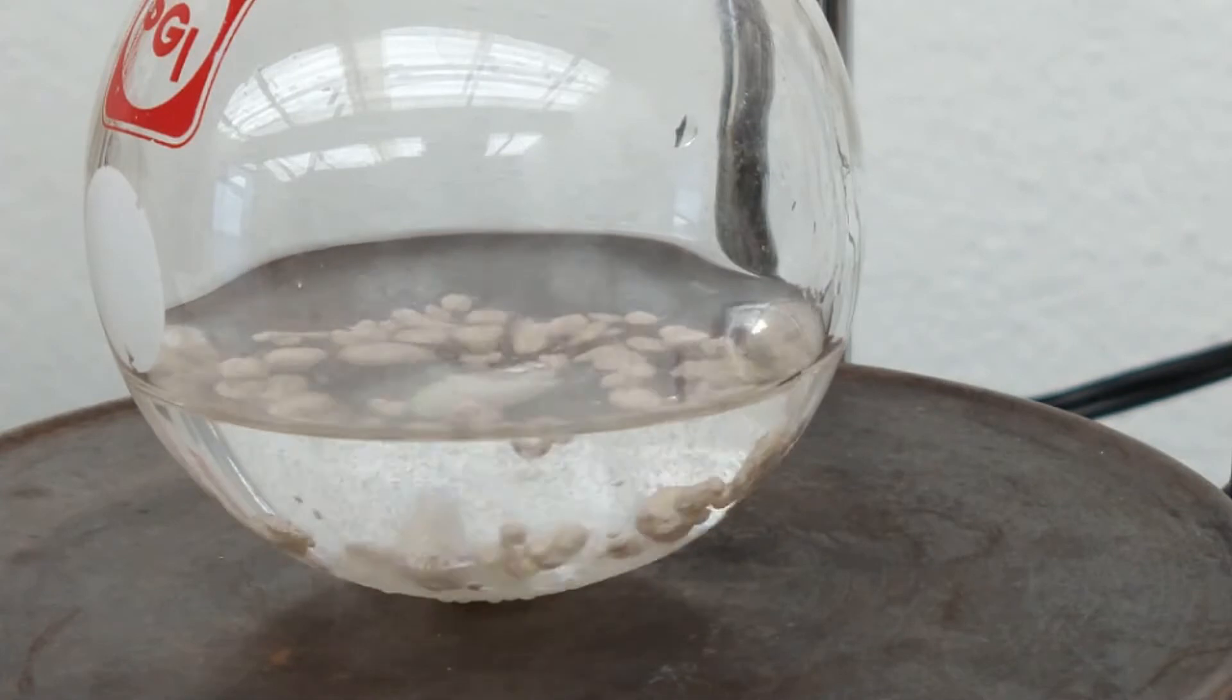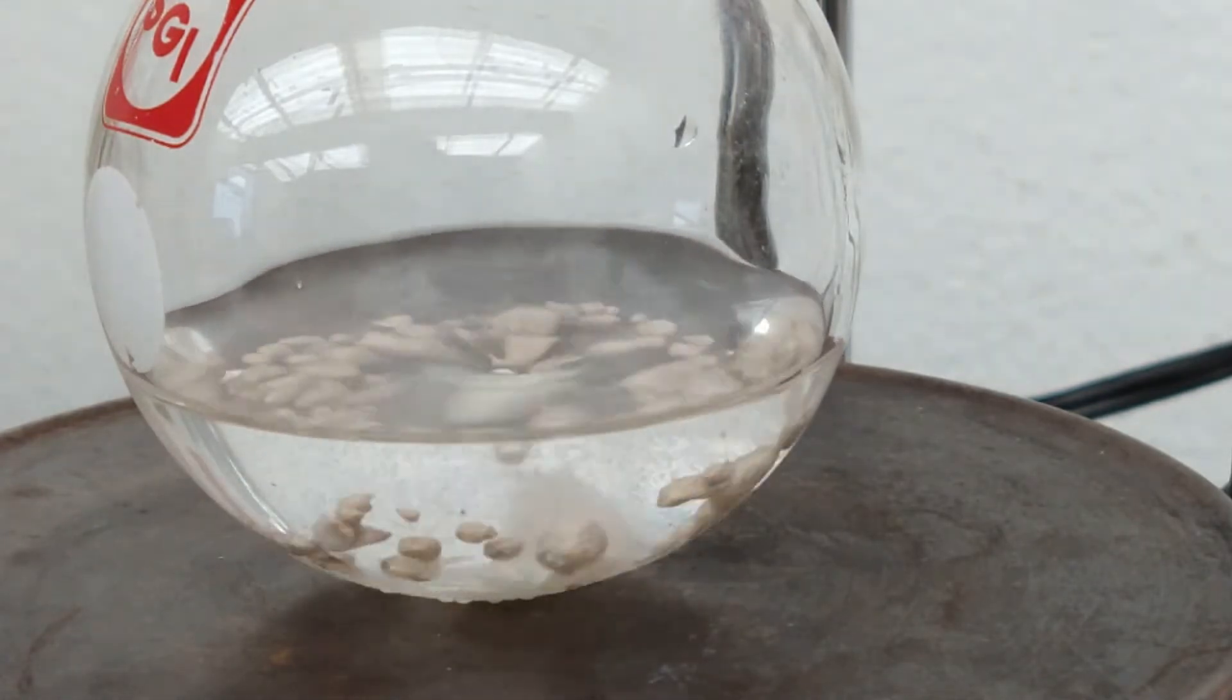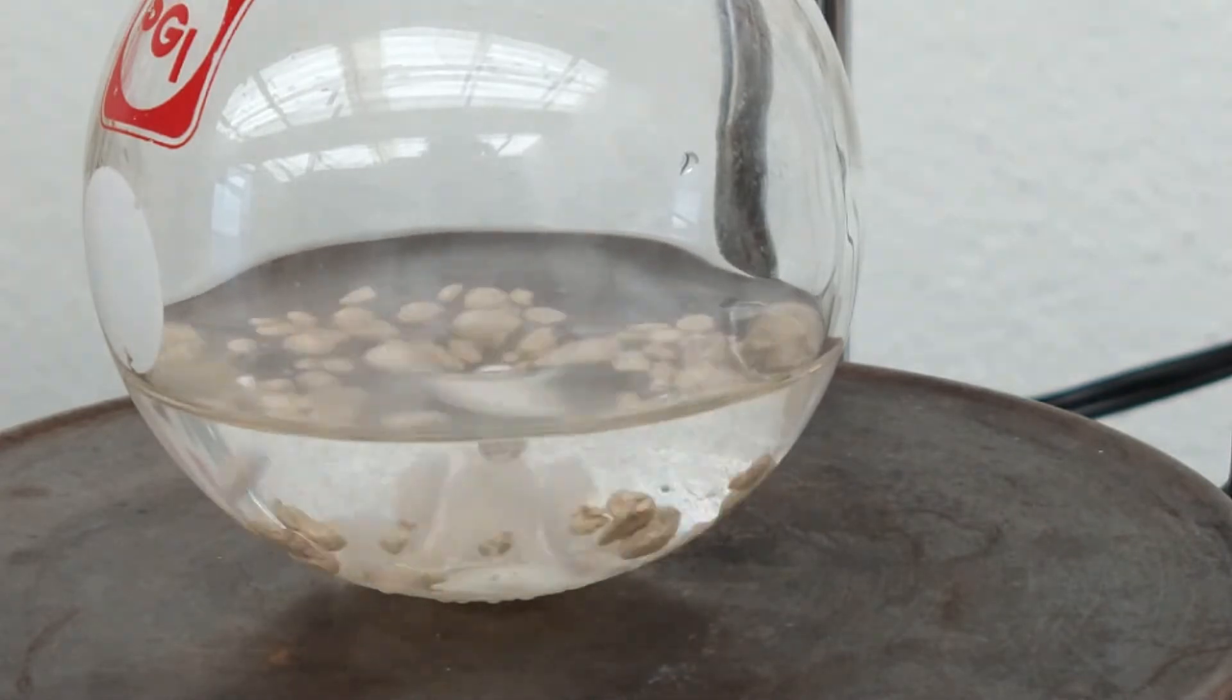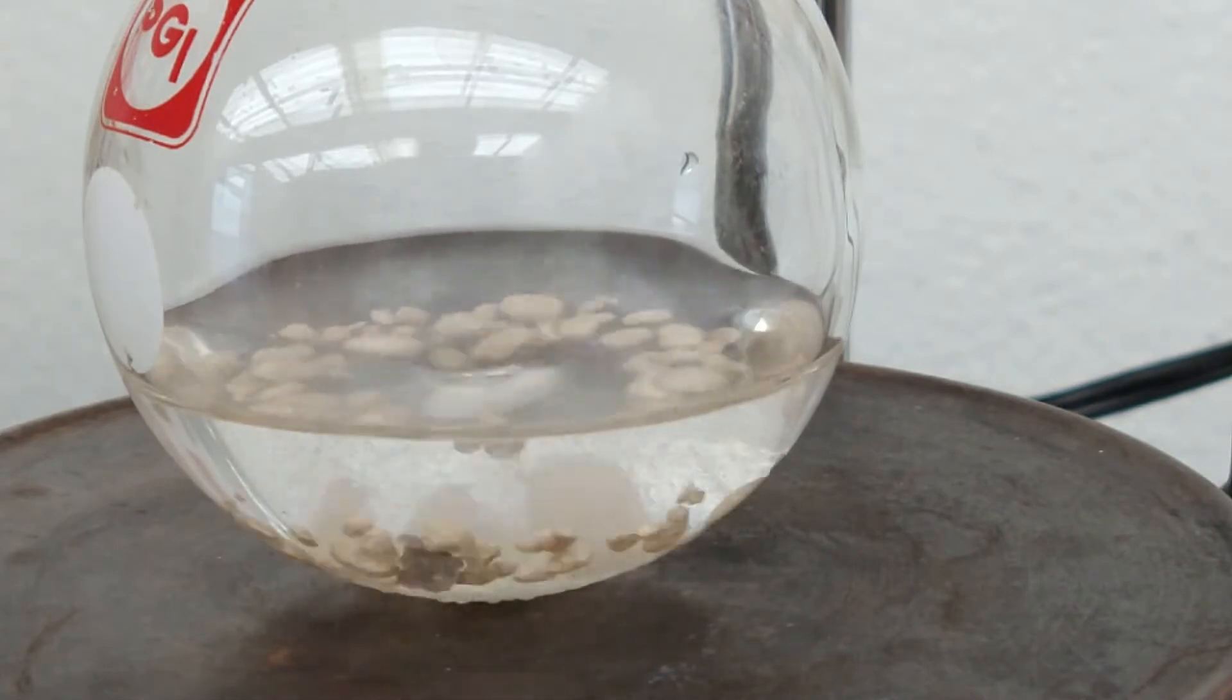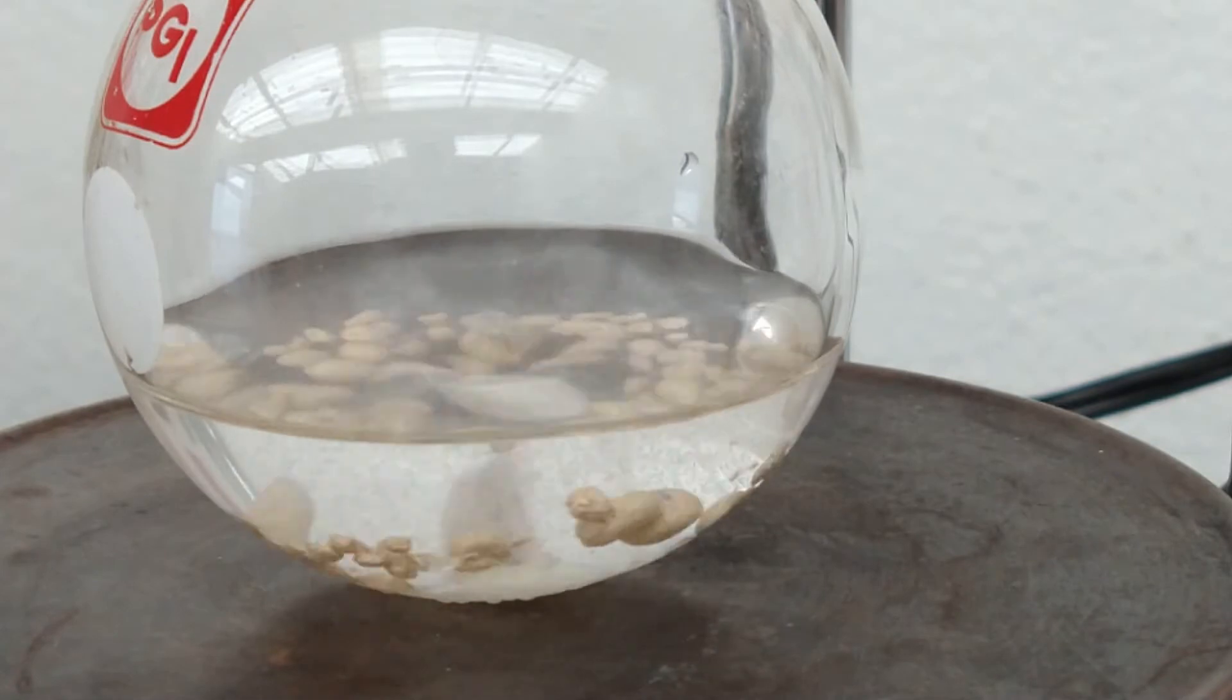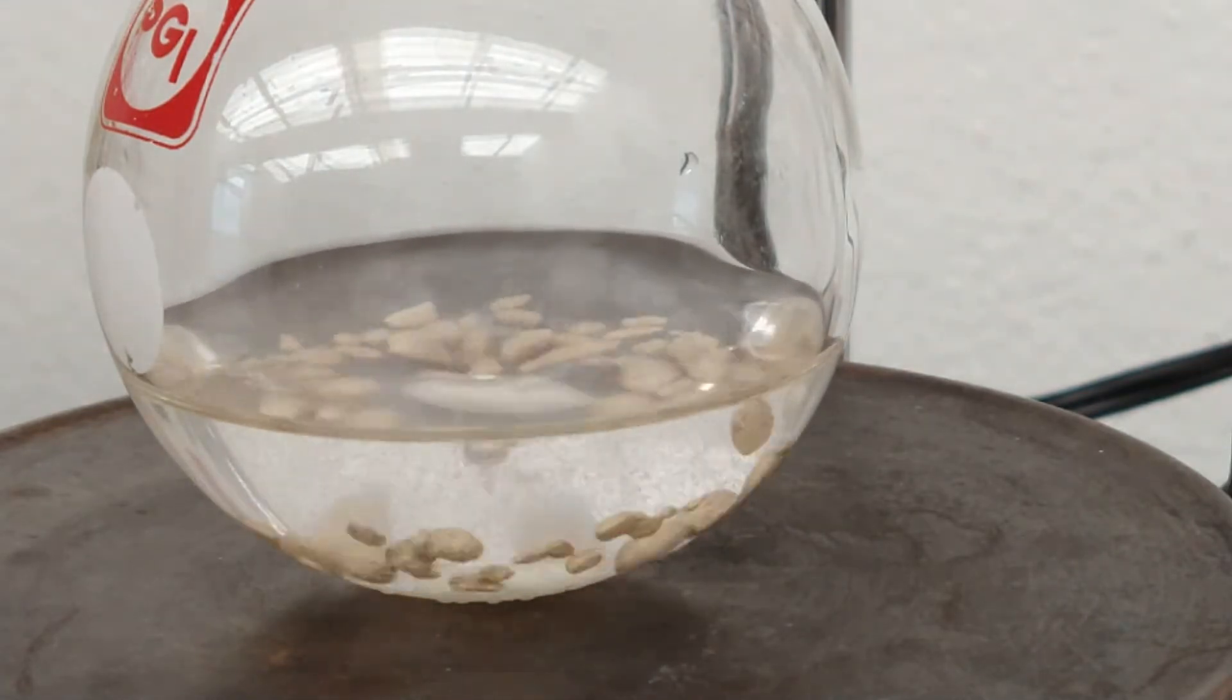Despite cleaning the sodium metal carefully, there are still some beads of sodium oxides floating around. As a side note, it's very important that we use ethyl acetate that is anhydrous or almost anhydrous. Technical grade is most of the time sufficient to do this kind of reaction, but you can't use ethyl acetate obtained from Fischer esterifications because you can't remove all the water in it.